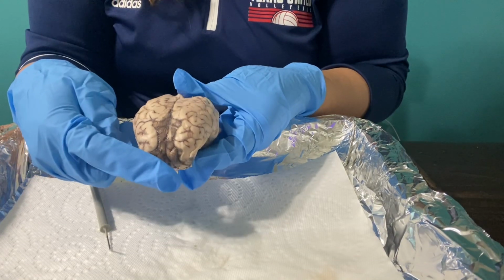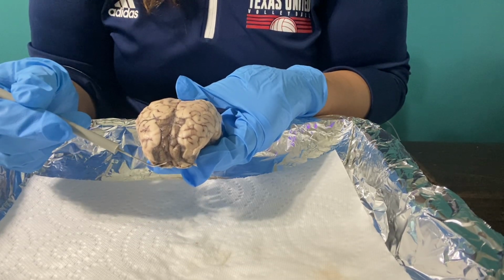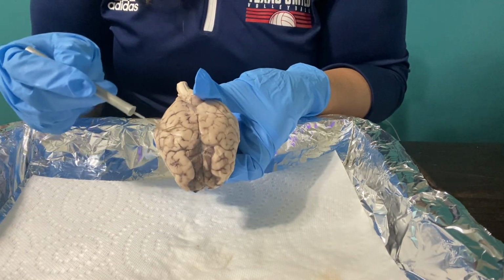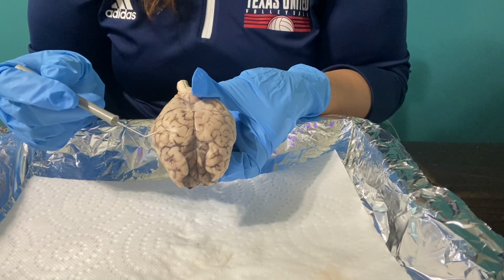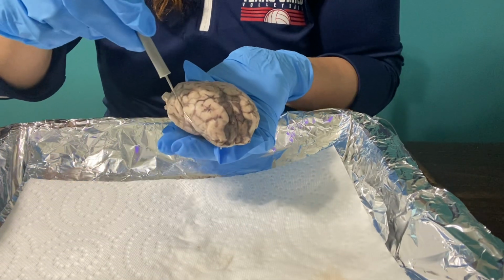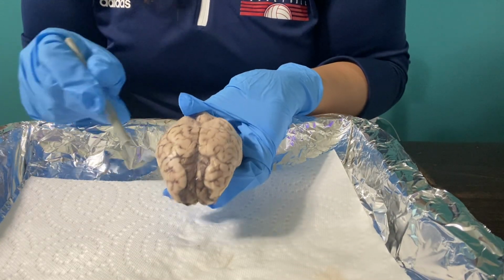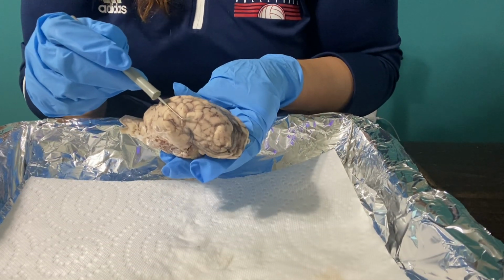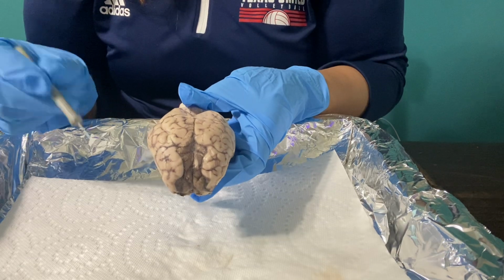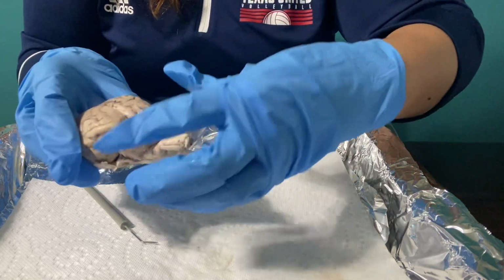So in the frontal lobe, this is normally where the decision making is occurring. There's processing and motor functions, as well as speech. This is all where it occurs. Okay. The parietal lobe, which is right here around the right hemisphere, that's where there's the collection of sensory information that's occurring. And then we have the temporal lobes on the side, right and left side. The temporal lobes are all about collecting and receiving information such as hearing and auditory information. Okay, and then lastly we have the occipital lobe, which is pretty much where the vision and visual memory are occurring.